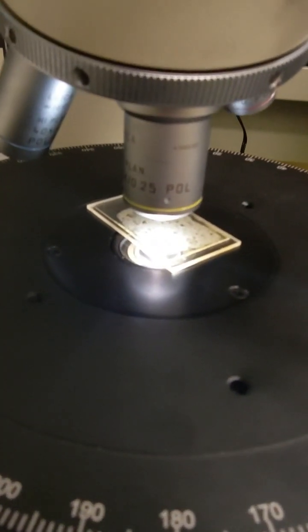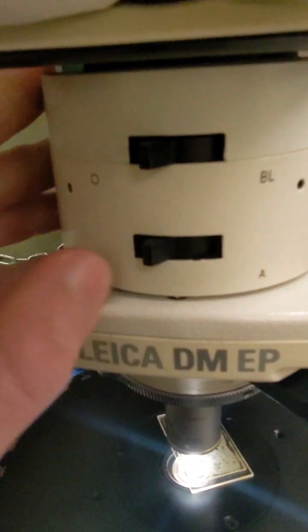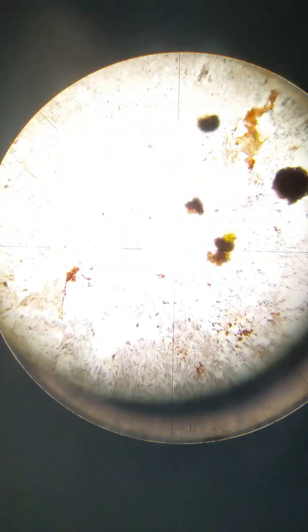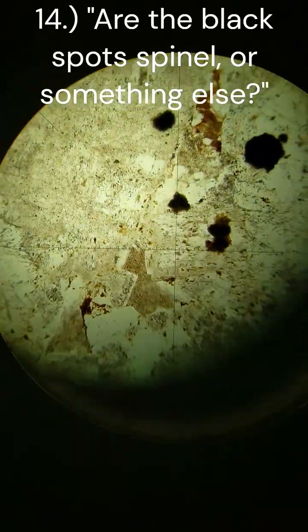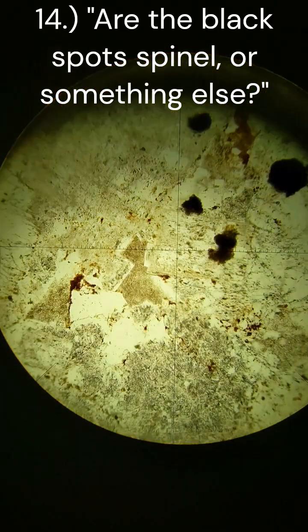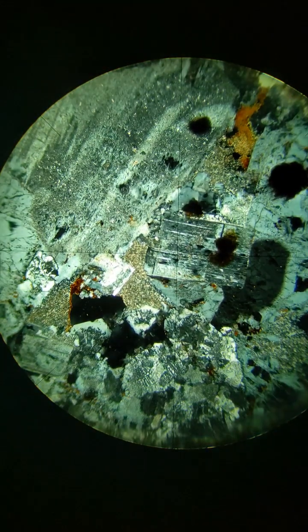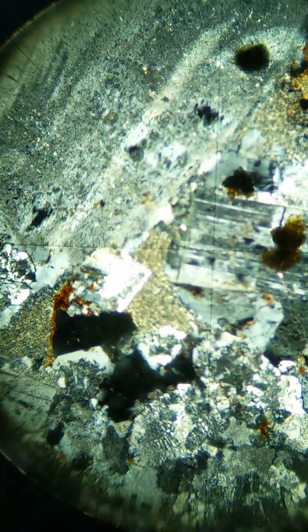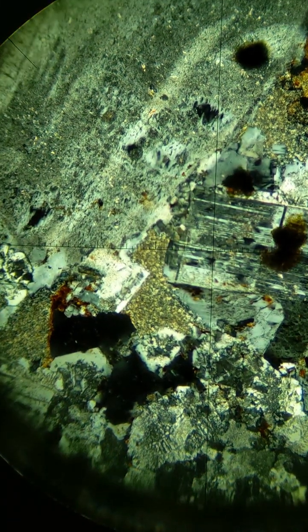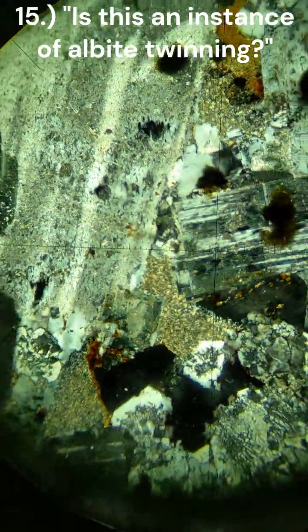This should be a volcanic felsic thin section. We're on 10x magnification, gypsum out, PPL, and it's mostly white, so nothing there. I do believe that the black spots there appear to be spinel. Going to go to crossed polars now. I would like to know if the centered feature there is a good example of albite twinning, or if that is something else.